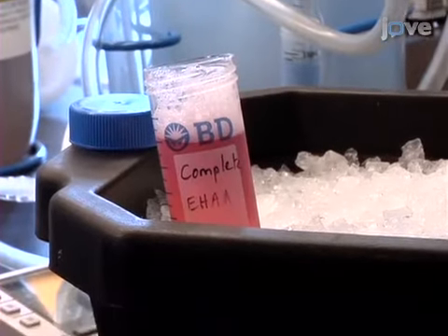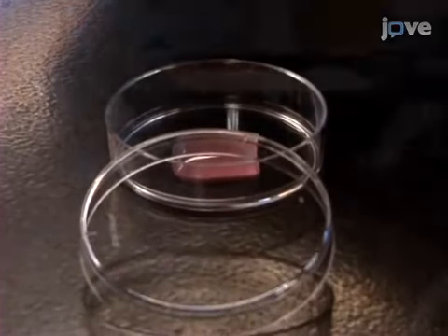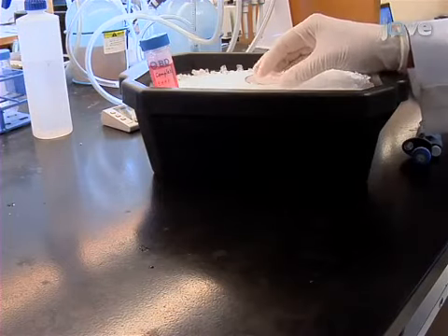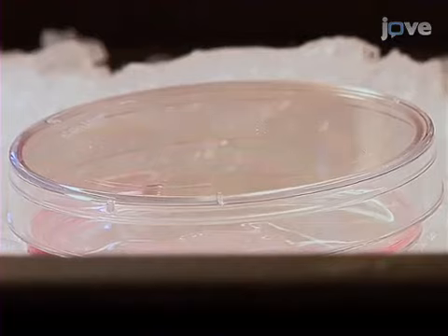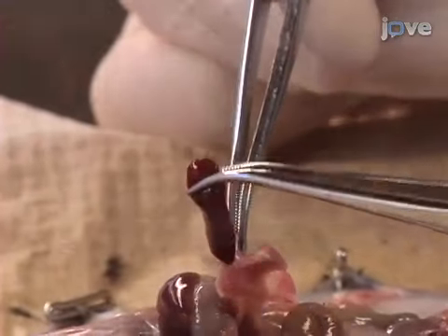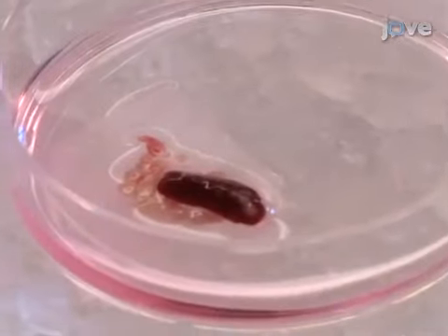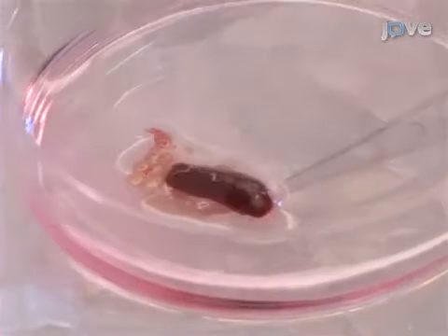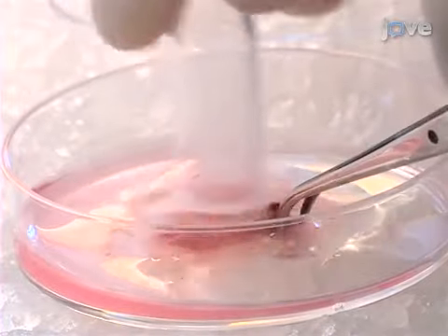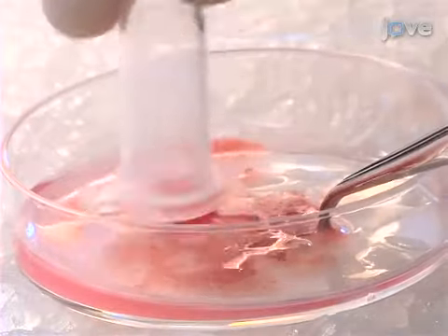Before starting the dissection, add 1 milliliter of complete EHAA medium to a 60 millimeter culture dish containing a small square of 100 micron nylon mesh and place the dish on ice. Then, remove the spleen from a euthanized mouse and as many easily accessible lymph nodes as possible. Place the tissues on top of the nylon mesh in the culture dish. Use the flat top of a closed 1.5 milliliter microfuge tube to gently mash the lymphoid tissues on the nylon mesh to liberate the lymphocytes.